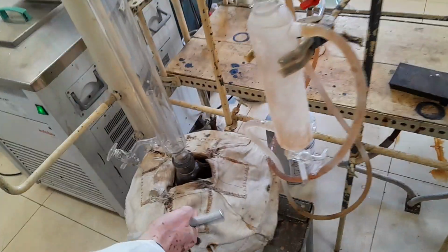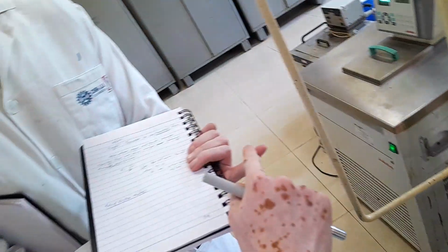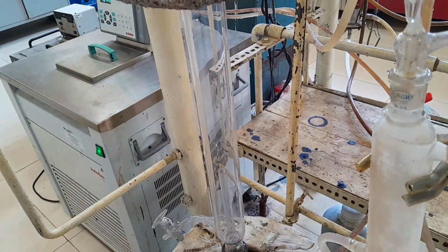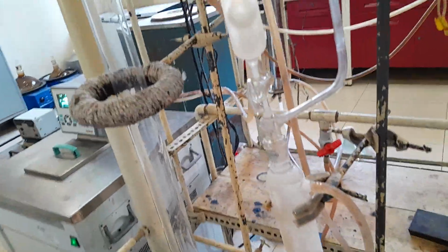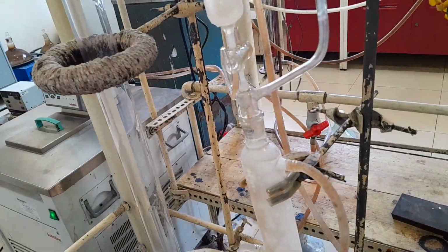First of all, when we heat, the vapor will come from here. The vapor might contain water vapor, and might contain the light gases. Light gases means C1 to C4. At first they will heat up to 20 or 40 degrees Celsius, or 50, 100 degrees Celsius, and then up to 160 degrees Celsius.